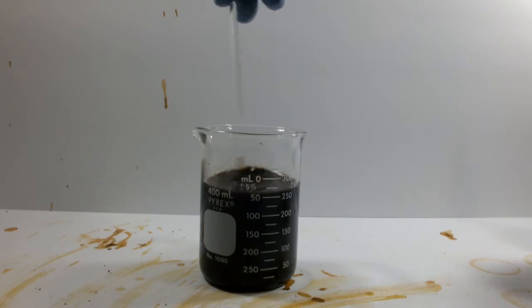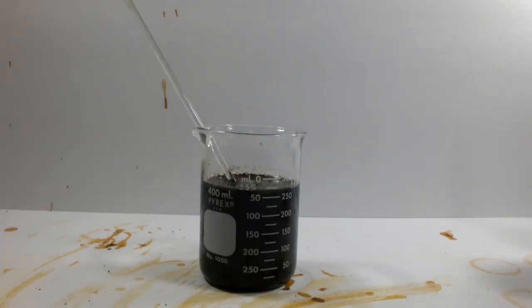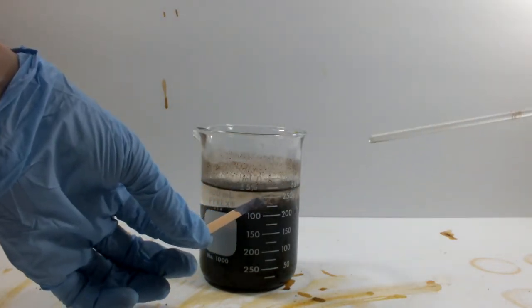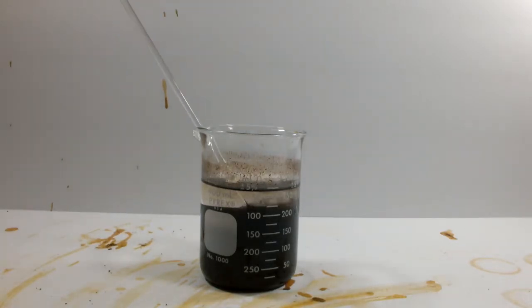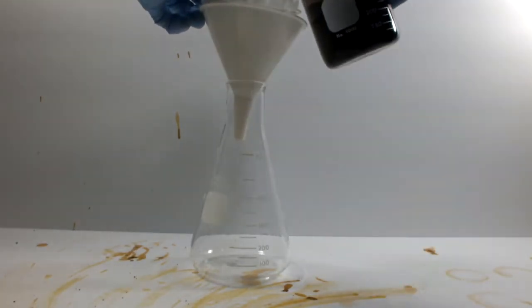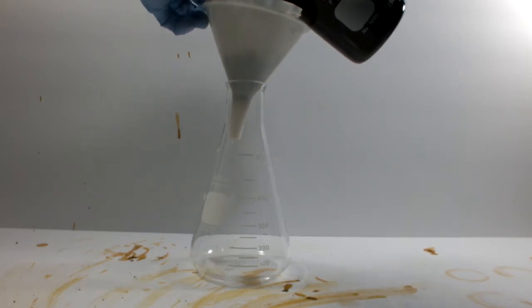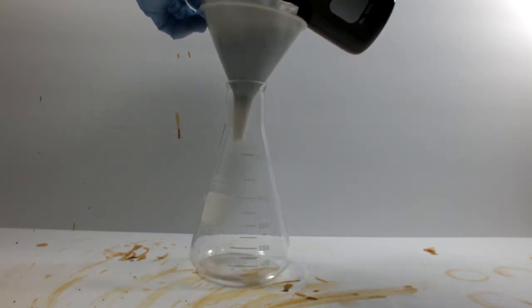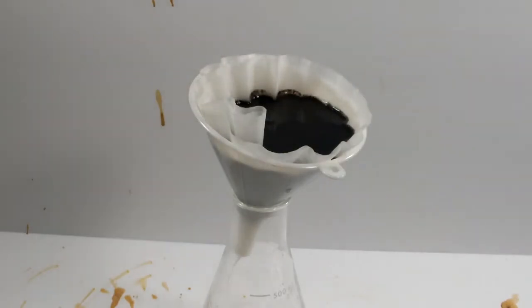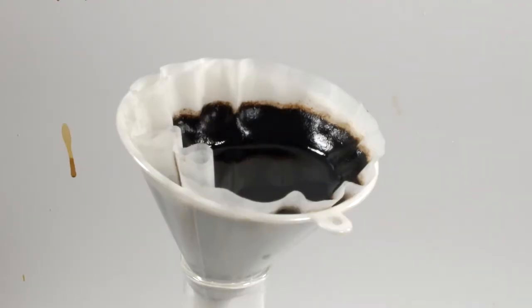After the addition of way too much sodium hydroxide, I let it settle a while. There we go. Let's check the pH. Yep, that was way too much sodium hydroxide. Another quick gravity filtration, and that will be that. In hindsight, I should have done vacuum filtration so I could wash it better. There's sure to be some excess sodium hydroxide in the final product. Interestingly, this product looks darker than the insoluble residue from the bottle.